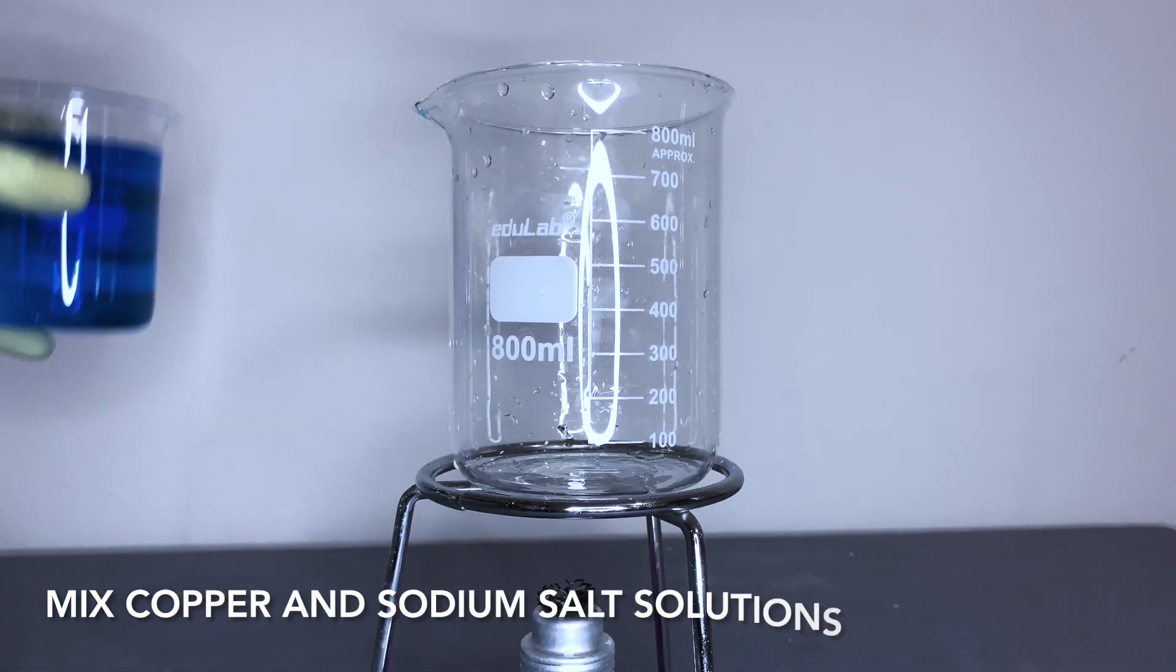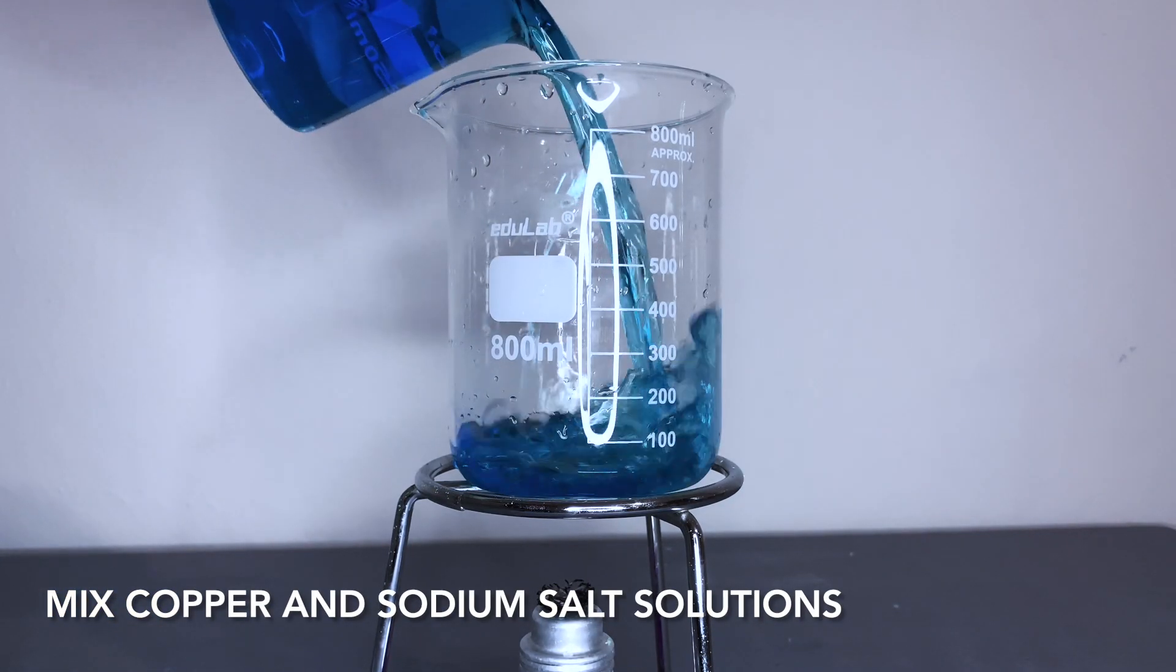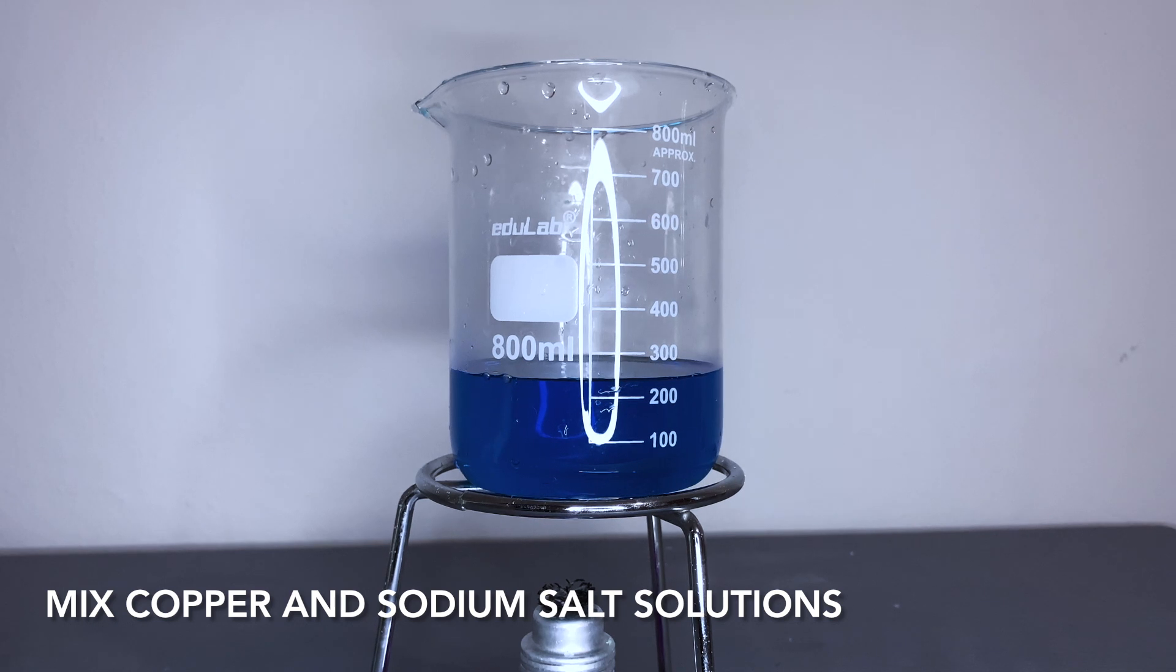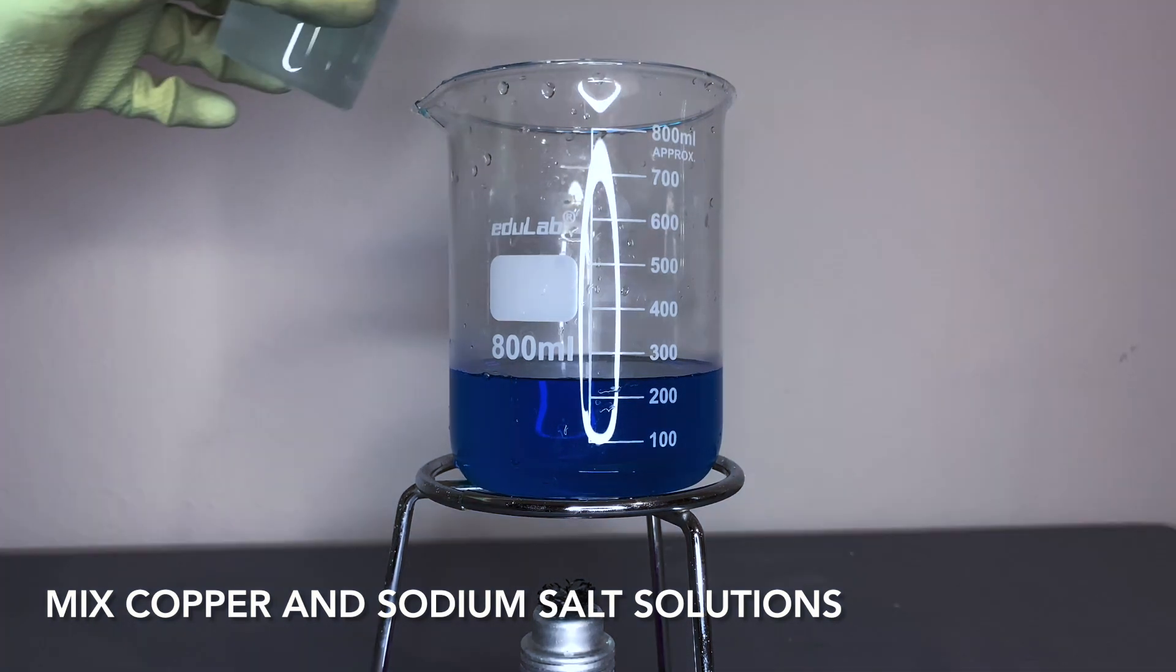Now, we came to the most beautiful part of the experiment. I add copper sulfate solution and sodium carbonate solution.